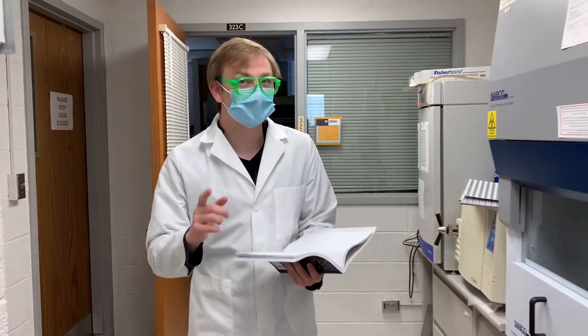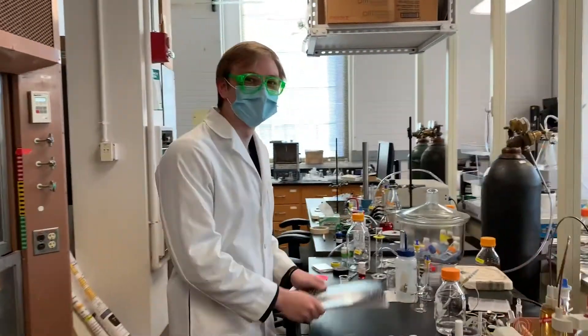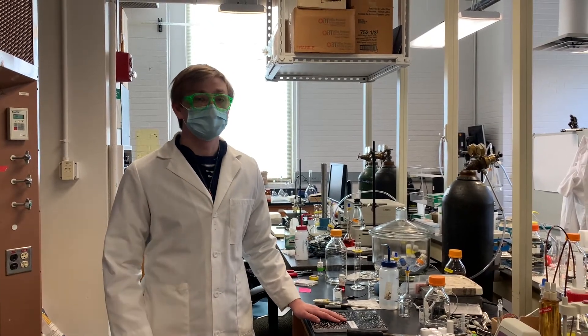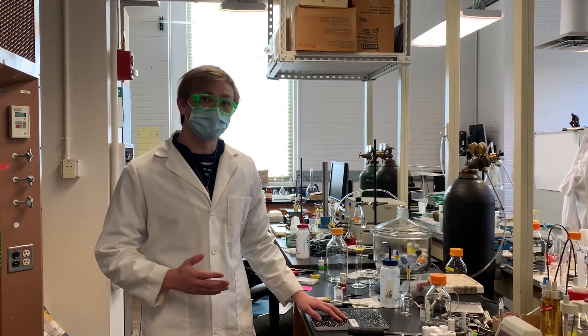Didn't see you there! Now, have I got a treat for you. Typically us electrochemists don't really do synthesis, but today we will. In this project we are investigating the complexation of bipyridine to transition metal complexes. Today we're going to see the synthesis of nickel bipyridine, performed by my lab mate Emily.